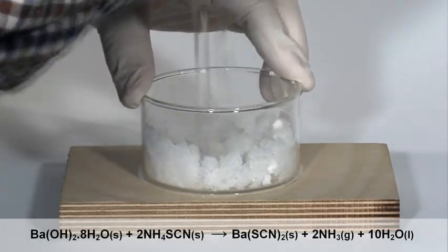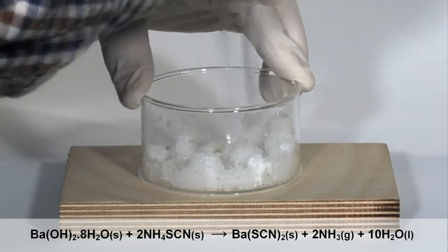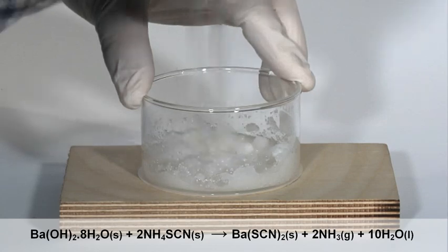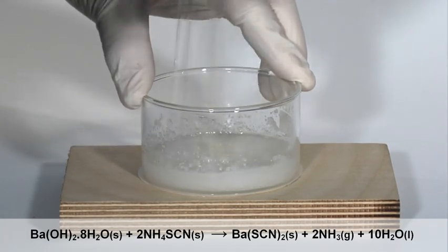A slurry is formed as the hydrated barium hydroxide and ammonium thiocyanate solids react to produce products including water in which they dissolve.